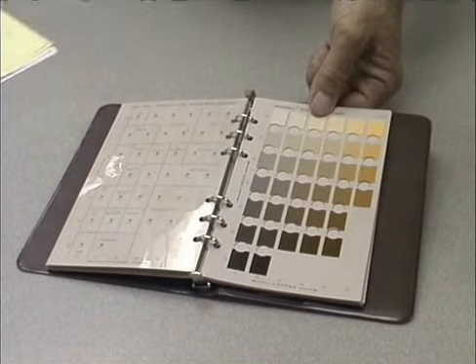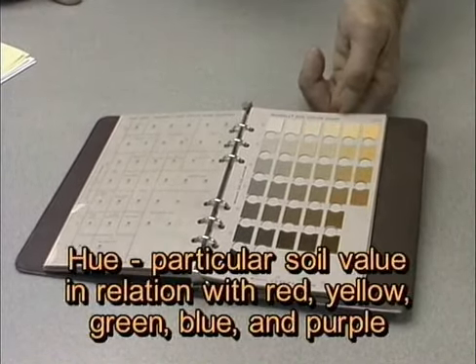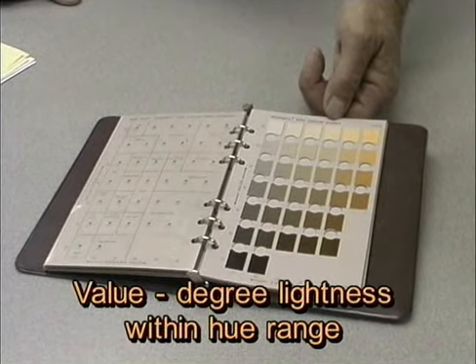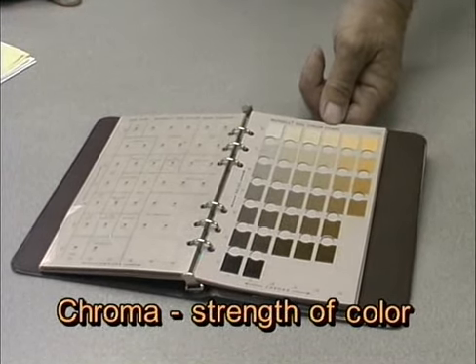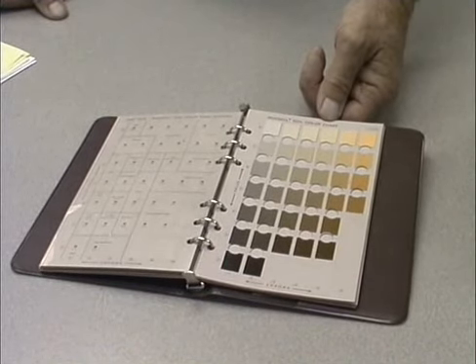Now, what do these hue, value, and chroma mean? Well, hue indicates this particular soil's value in relation to red, yellow, green, blue, or purple. Value indicates the degree of lightness within that hue range, and then chroma indicates the strength of color, or the degree of departure from neutral of that same lightness.